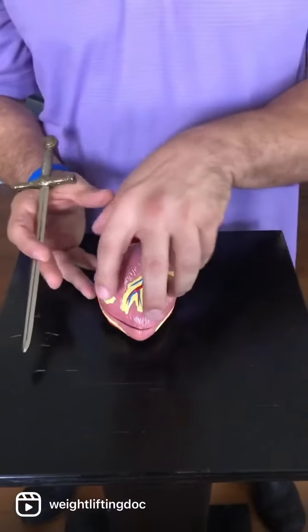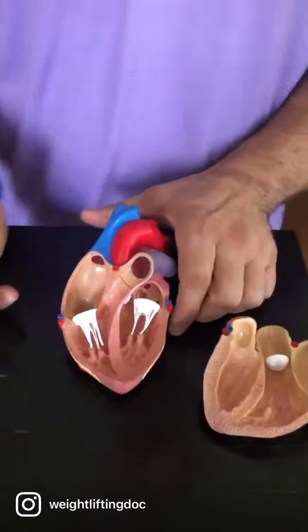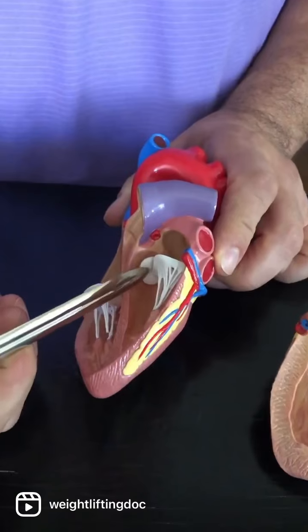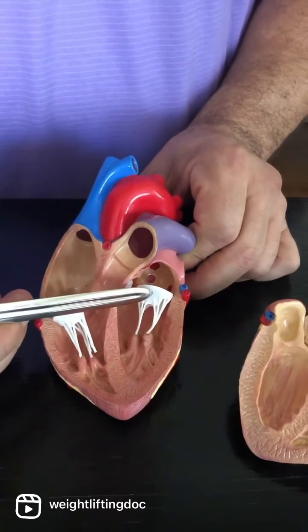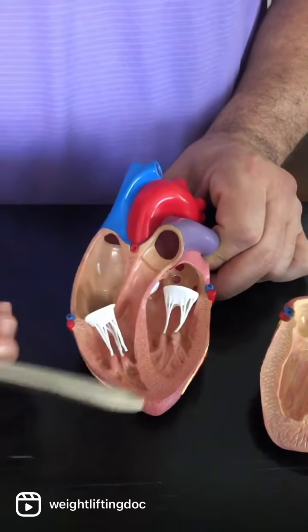We've got this small heart here. We're going to open this guy up. I want to show you a couple of things on this particular heart. The aortic valve you can see a little bit better, so if you couldn't see it as well on the other, just so you know where it is on both models, that's the aortic valve or the aortic semilunar valve. These are, on the left side, bicuspid, right side, tricuspid valve. Again, the bicuspid is also called the mitral.